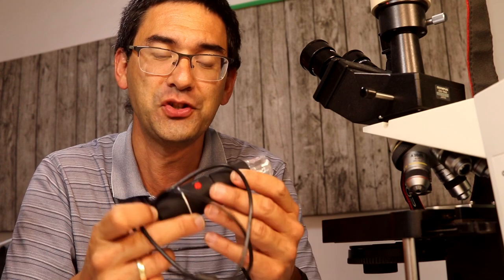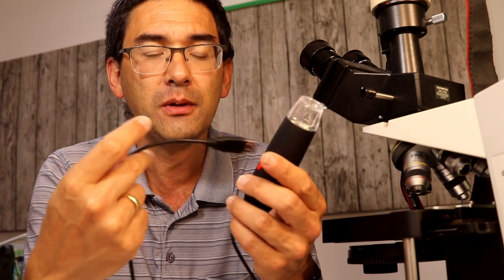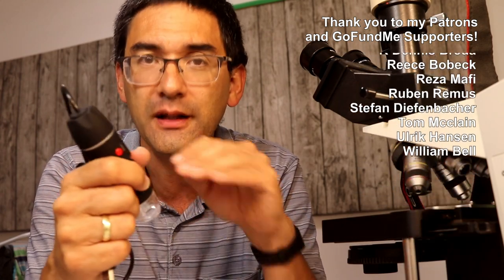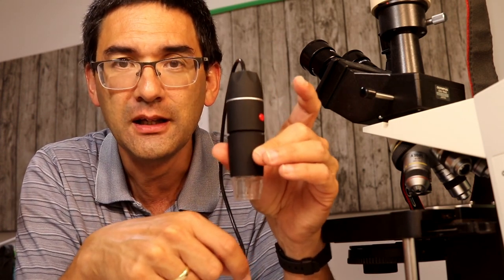Now the vitamin C, which is also quite interesting and looks a little bit different. The scratches of the sticky tape are quite visible. I need to adjust the analyzer again. I'm rotating the analyzer in the objective and look what happens - the background becomes dark. I have to wait for the camera to adjust the exposure. That's basically what you see here. One of the nice things is that the system is quite easily adjustable.